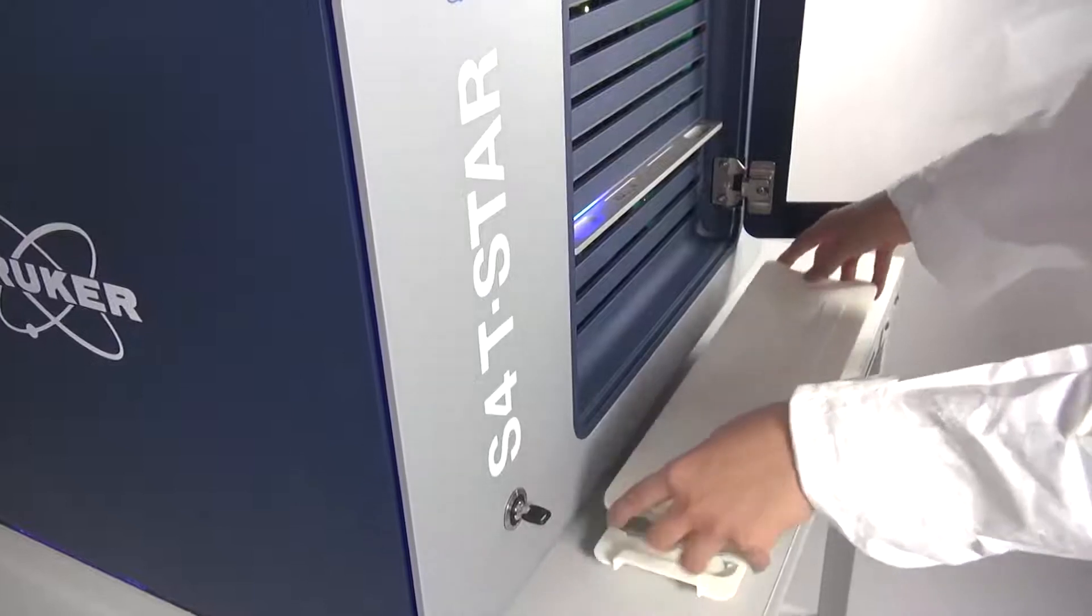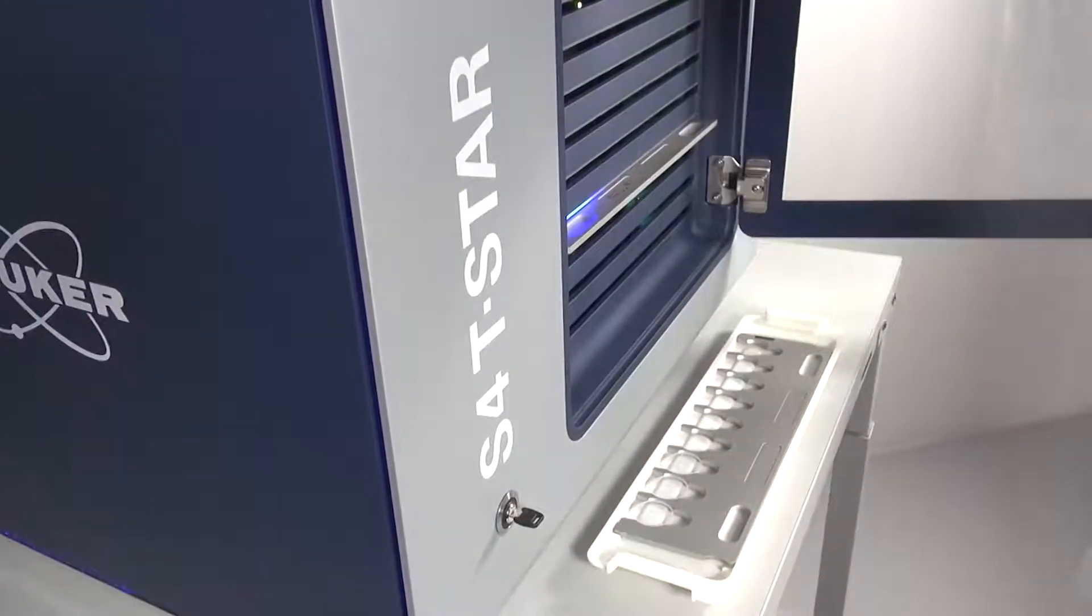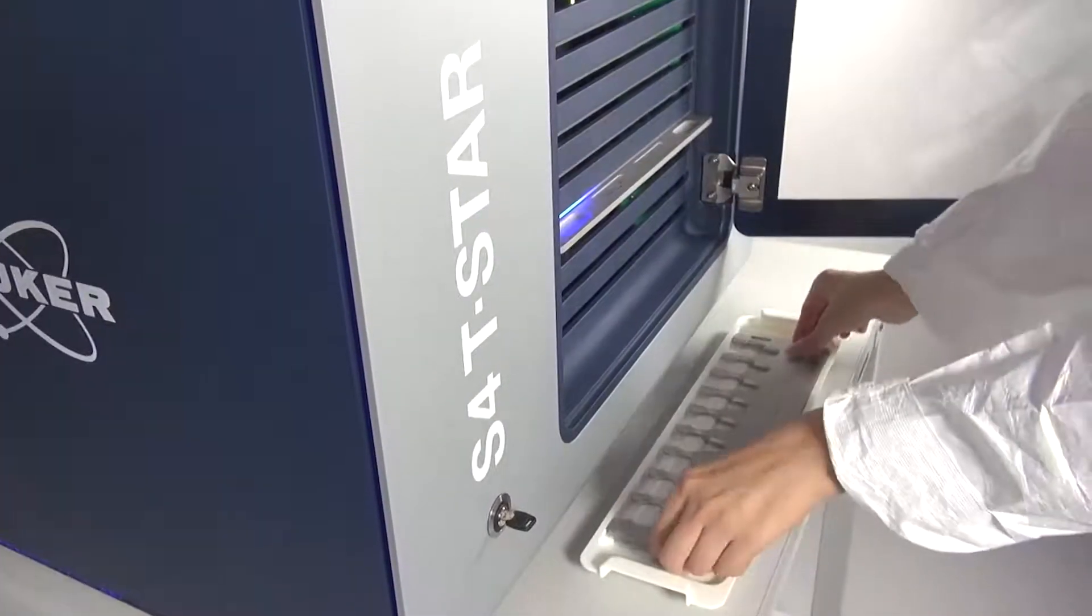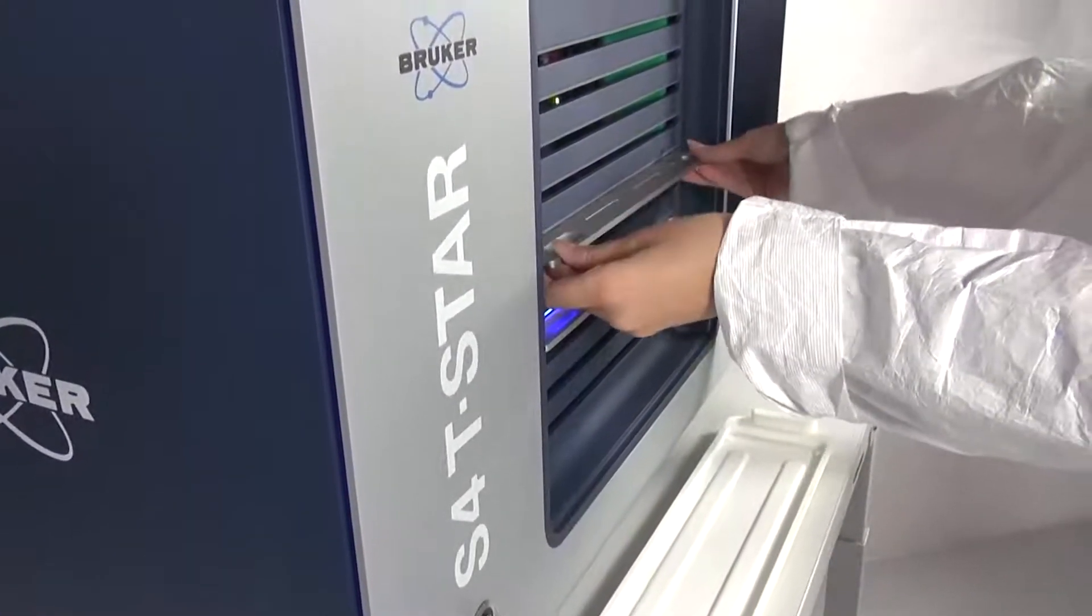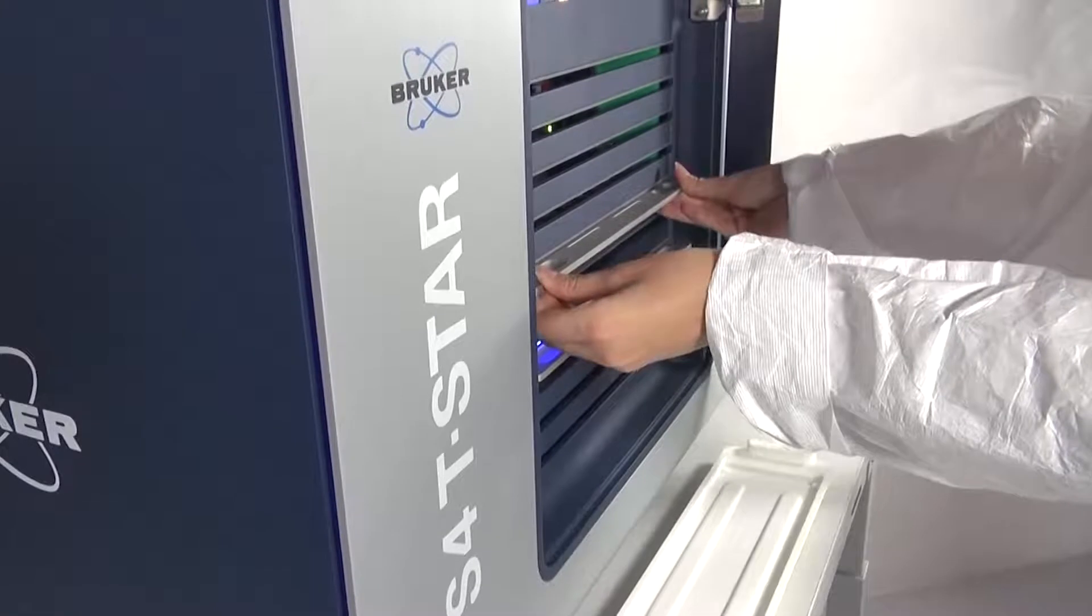The instrument is prepared for continuous 24-7 operation and the door can be opened at any time. Sample trays are loaded and automatically recognized, which is shown by a flashing LED line.